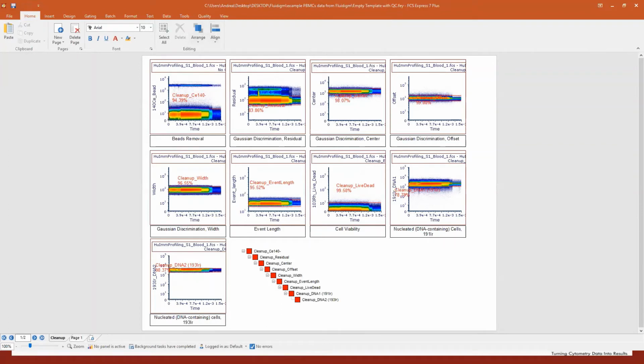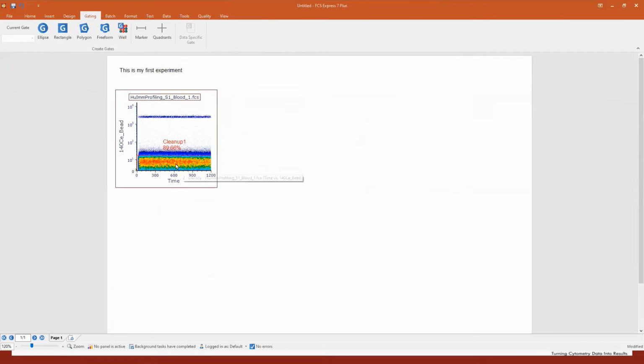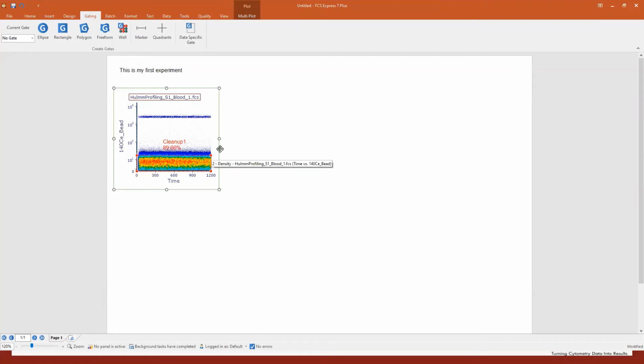And as you can see here, usually you start with time versus 140Ce bead, and then you have time and residual, and then you have time and center. So you go through all those cleanup gates one after the other. So we are here. How can we create plot number 2? Well, let me go back. It's really easy. We want, of course, plot number 2 to be gated on the cleanup 1, right?